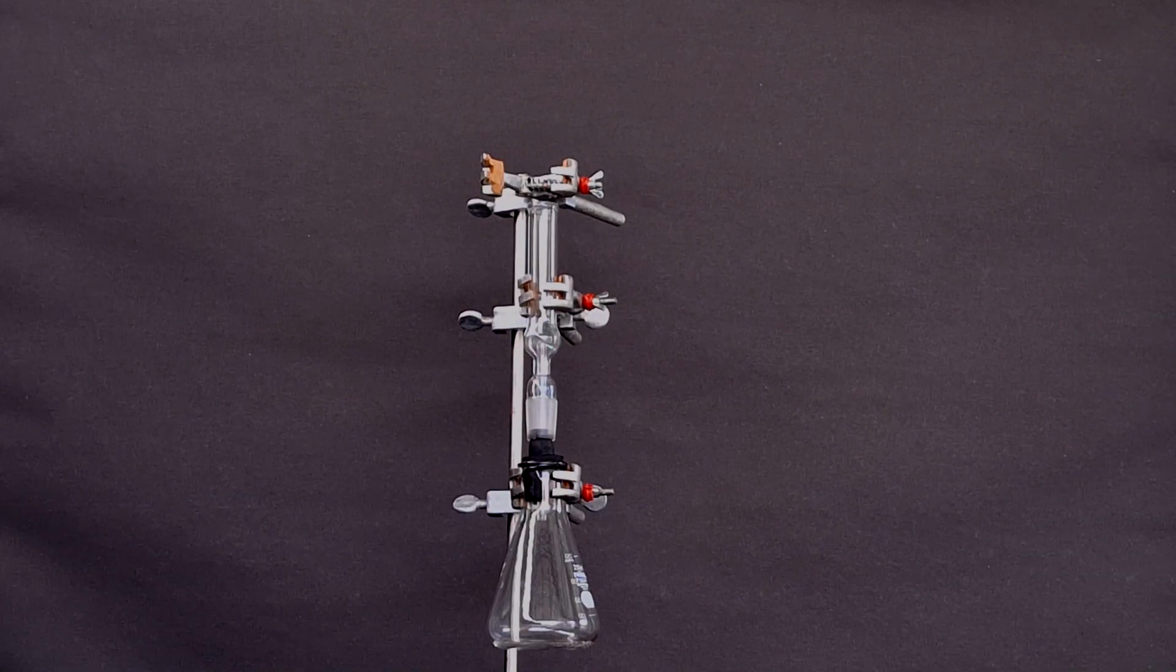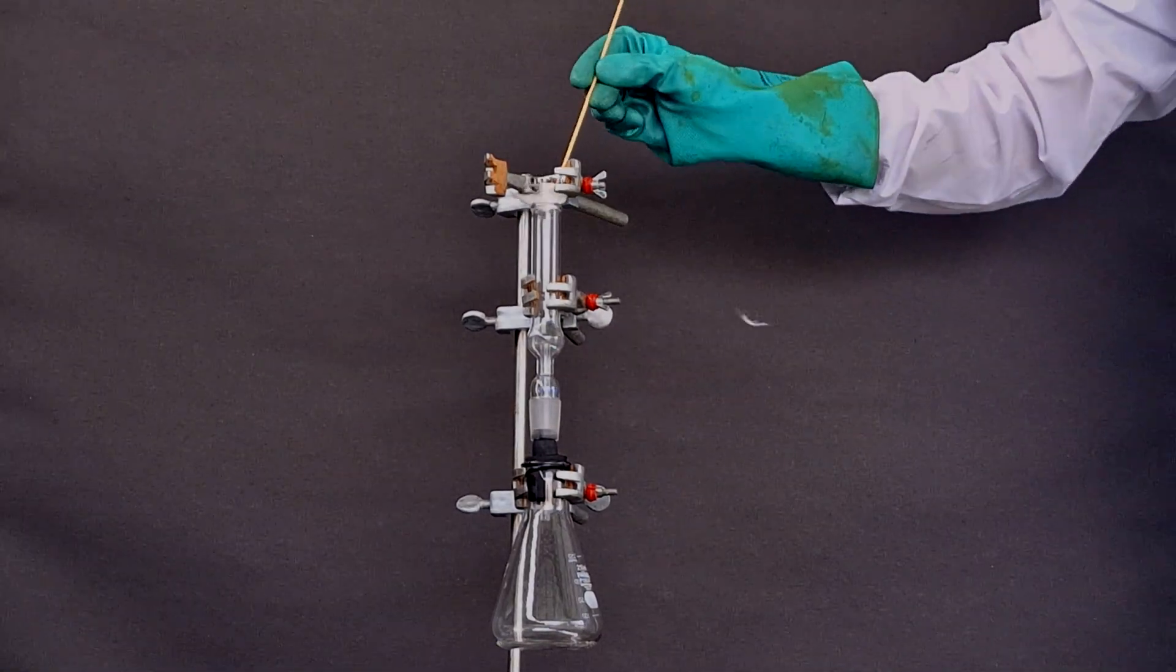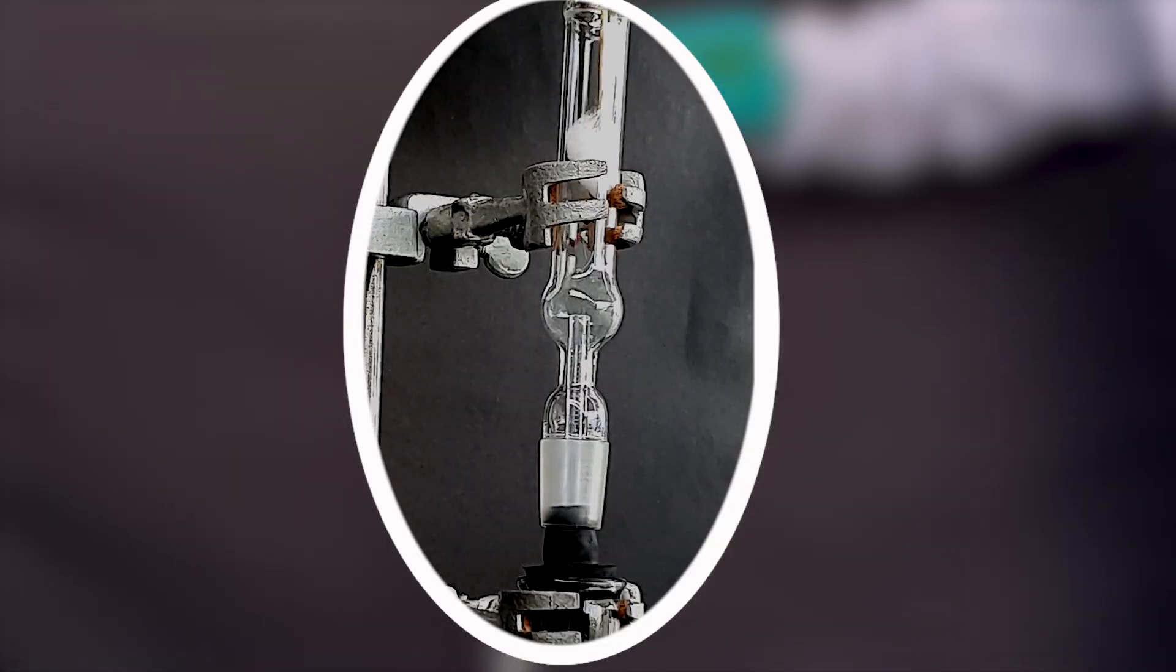With the drying tube now attached, I slid a piece of cotton into it to act as a base for our drying agent, calcium oxide.